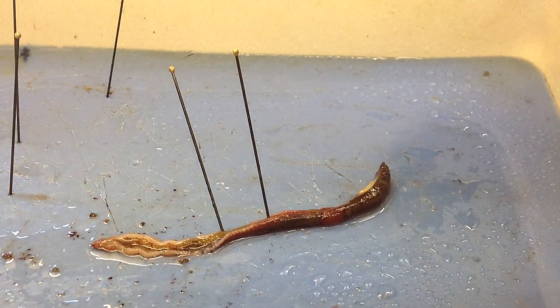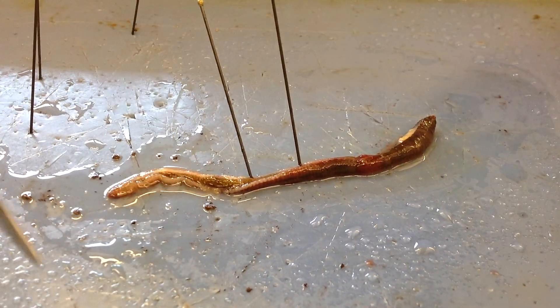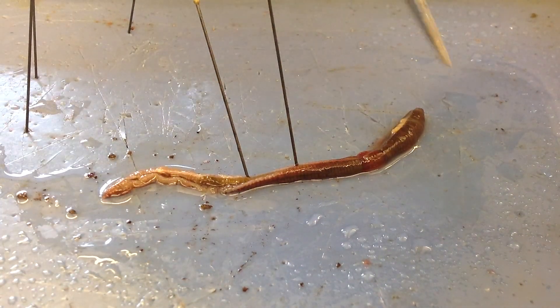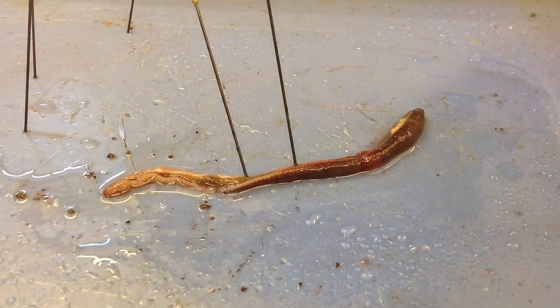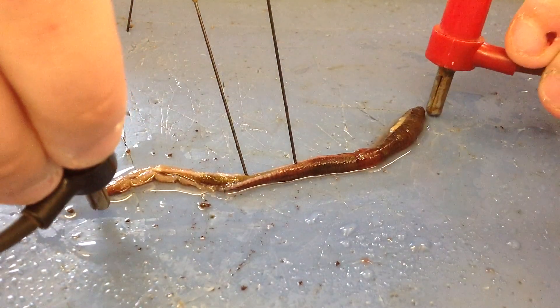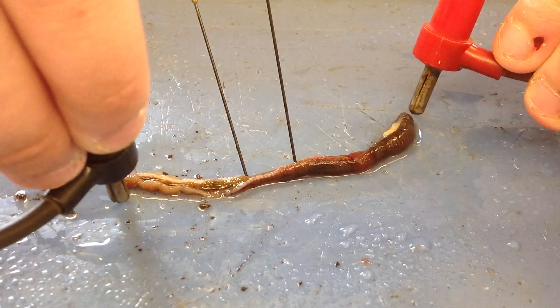I'm surprised it can still contract after we sliced it open. So just to prove another point, it's kind of dead, it's not moving anywhere. So you can see the effect of electric current on the worm's axon.